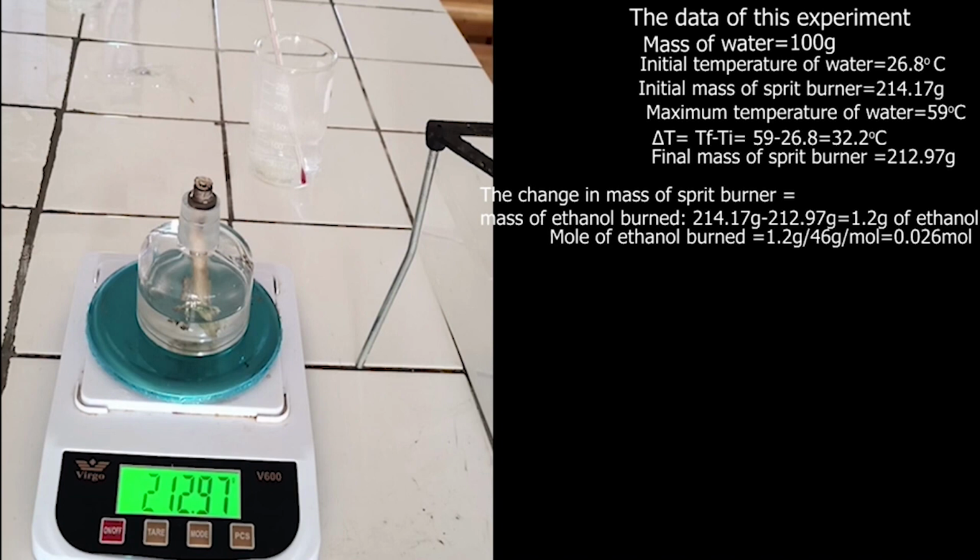Important thing in this measurement: the heat released by burning alcohol is absorbed by water. Pay attention, I want to repeat this important thing in this measurement. The heat released by burning alcohol is absorbed by water. If you know the heat absorbed by water, you know indirectly the heat released by burning alcohol.